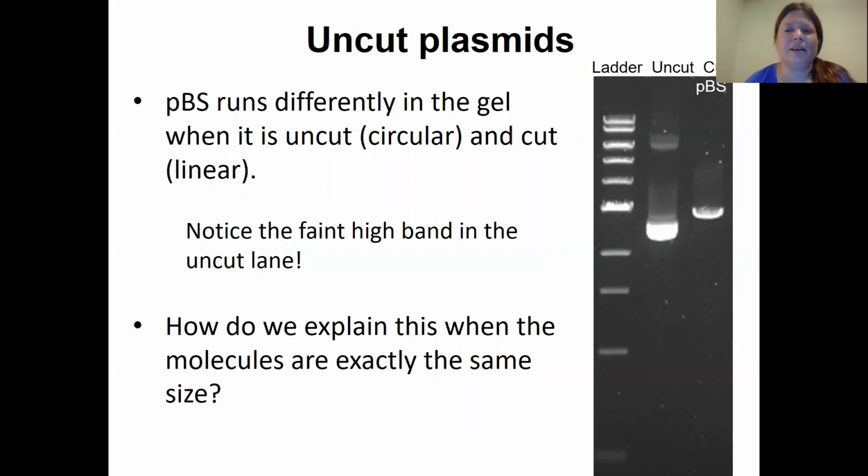Uncut pBluescript, whether it's cut or not, is 3 kb. And if we look at the uncut lane, it's just one sample. It's running at 2 different sizes, neither of which are 3 kb. That tells us this is undigested plasmid. I want to distinguish between undigested plasmid and partially digested plasmid. Those are very different things. Don't call one of them the other on the post lab or you'll be wrong. It's partially digested if some but not all of the sites have been cut. It's undigested if none of the sites have been cut and it's still circular. So remember that distinction, please.